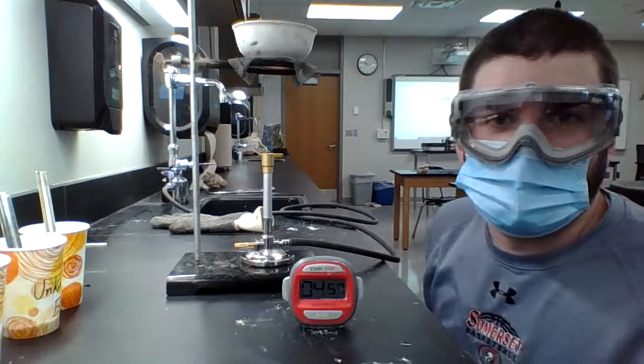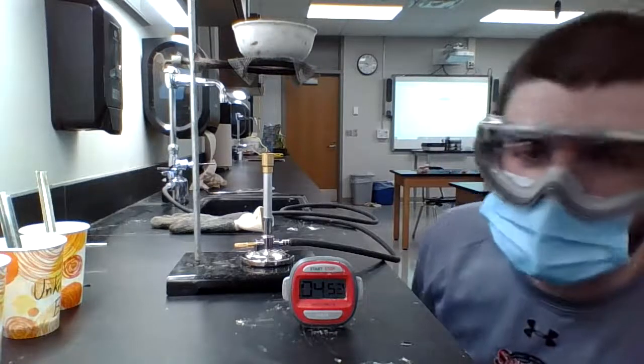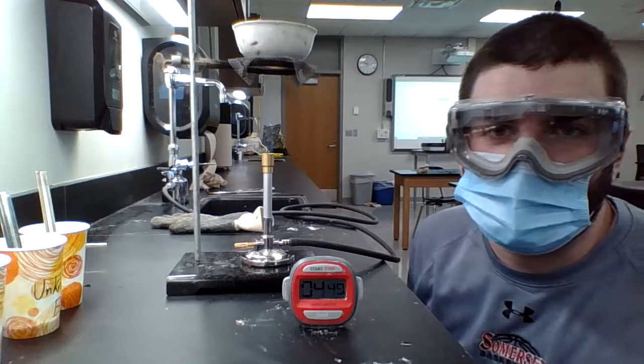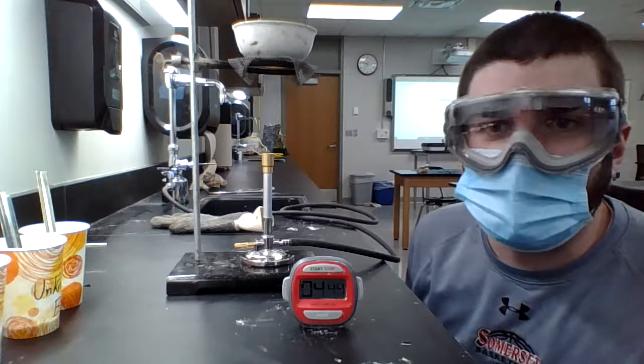All right. So I just got it cleaned out. We've got unknown B officially running. The timer has just started. So in a couple of minutes, we'll see if it melts or if it does not melt after five minutes. So I'm going to pause it and we'll come back and see what happens.